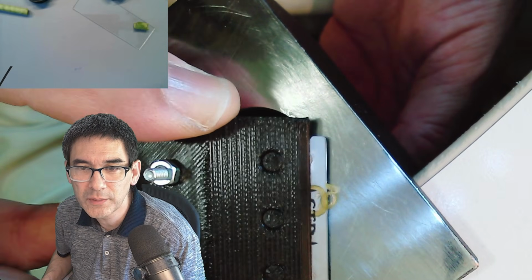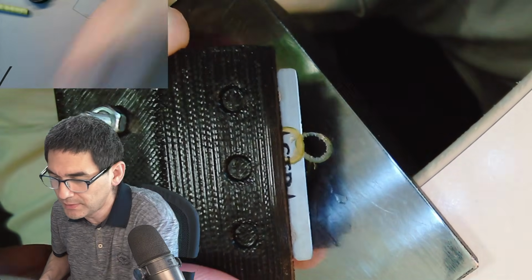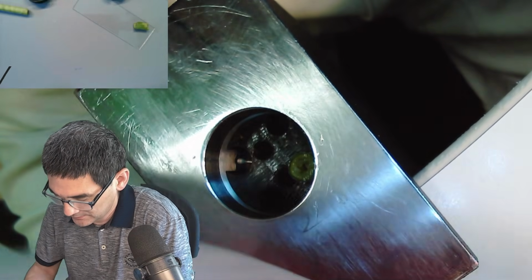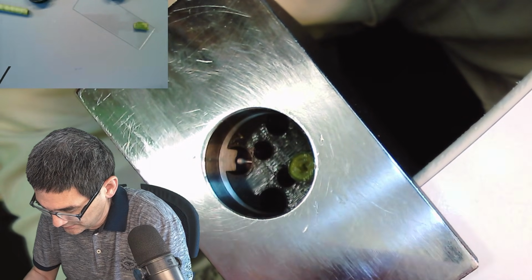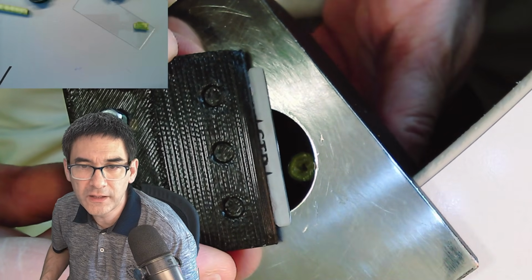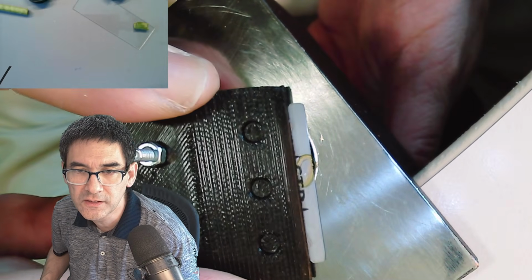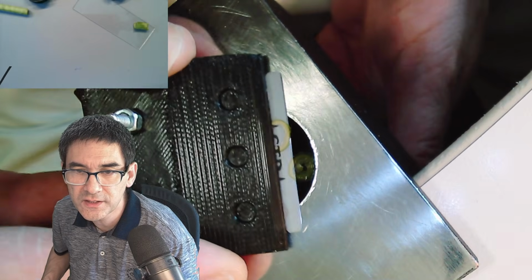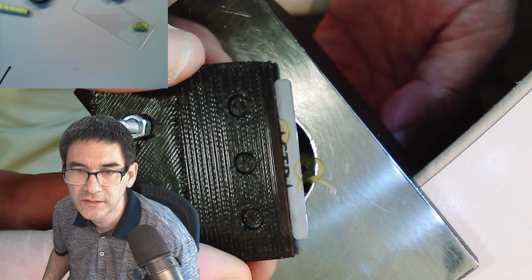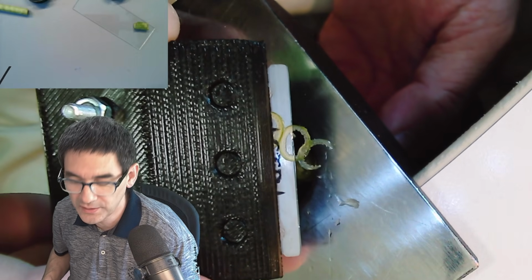What I'm going to do now is put this a little bit into some water, or maybe it's enough if I put it directly on a microscope slide. It's fairly wet anyway. So here we go. 1, 2, 3, 4, 5 is too little. 1, 2, 3, 4, 5, 6. I think so. We're going to see how well this actually works.